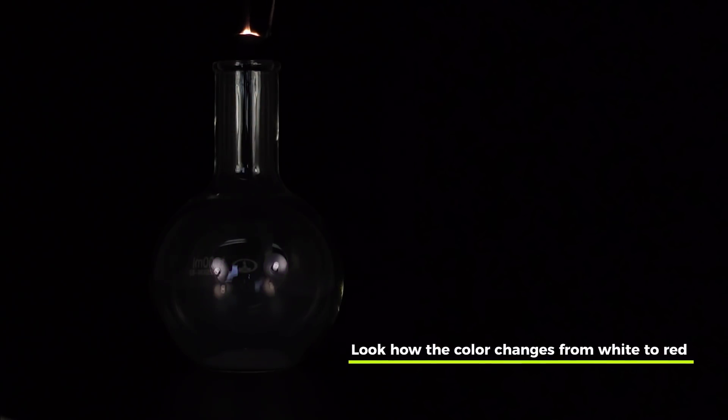To show you the reaction of lithium and sulfur hexafluoride, I fill this little flask with the gas and put a small burning piece of lithium.